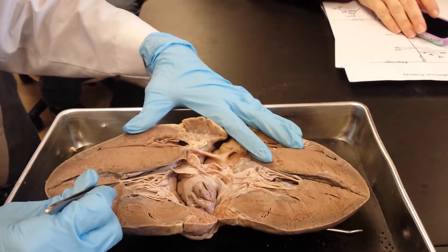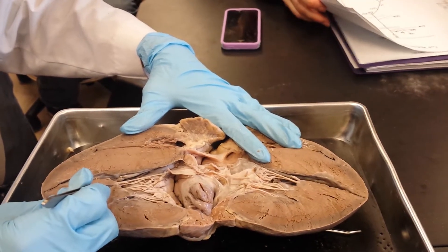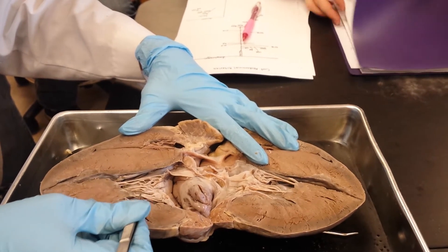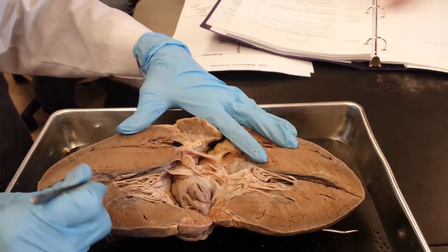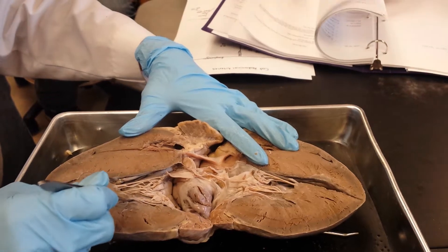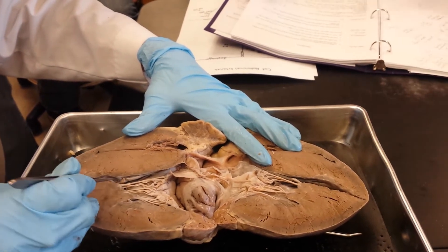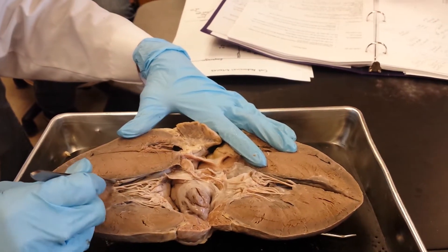There's going to be a muscle at the bottom. If you follow the chordae tendineae down, you can see these little bump muscles here in the wall — those are your papillary muscles. Here's another nice papillary muscle here.